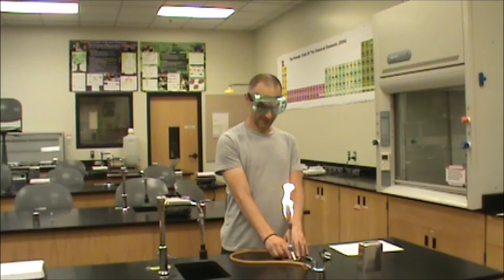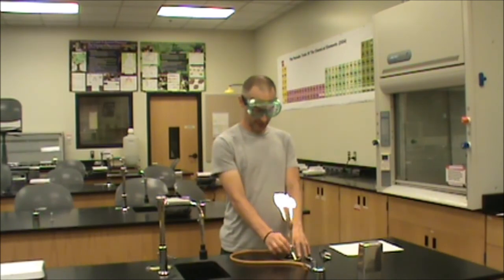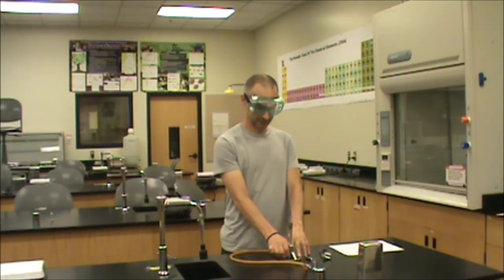And depending on how the valve at the base is adjusted, the flame can be very large. If this happens, don't be alarmed. All you need to do is turn the air adjuster counterclockwise to adjust the amount of air to go into the flame.